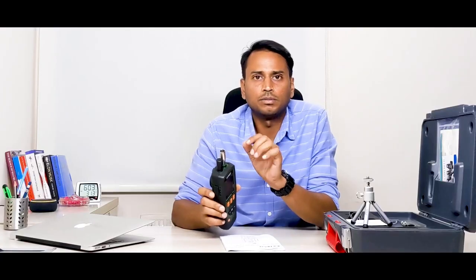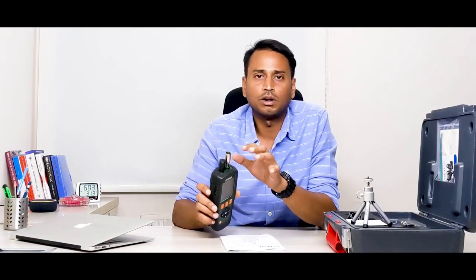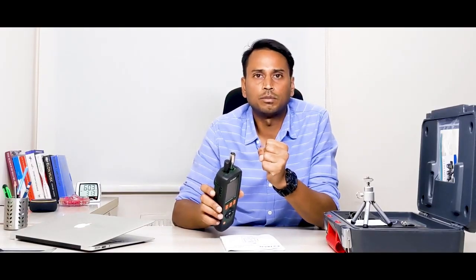It basically displays the particles at the same time. This particle counter works on the principle of sampling with a sampling pump. So it takes some air from the room, samples it and then gives the result. The flow rate of this instrument is 2.83 liters per minute with the help of an internal pump. The counting efficiency of this device is 50% at 0.3 microns. For the coincidence loss, this instrument has 5% at 2 million particles per cubic foot.